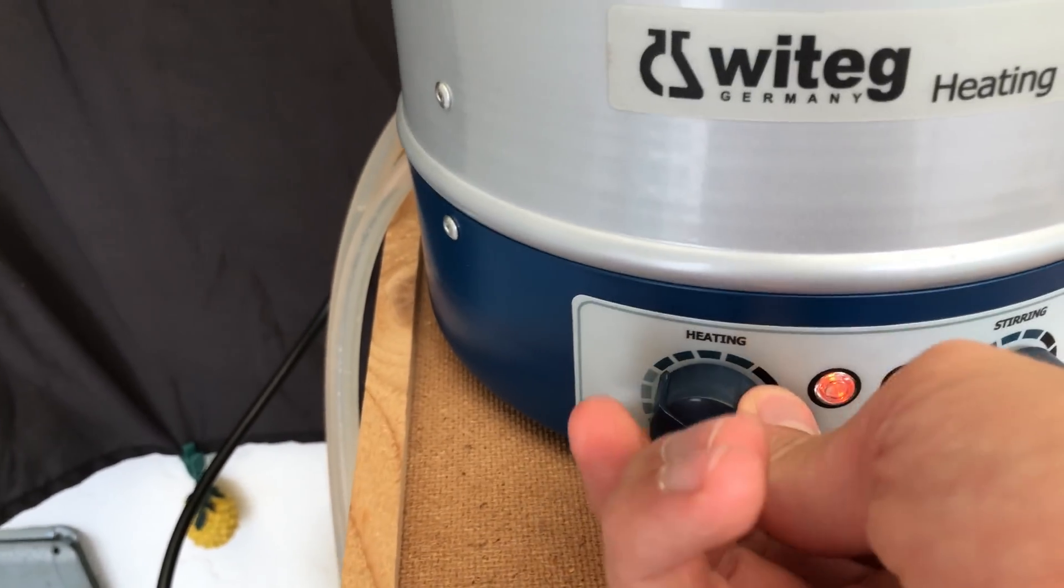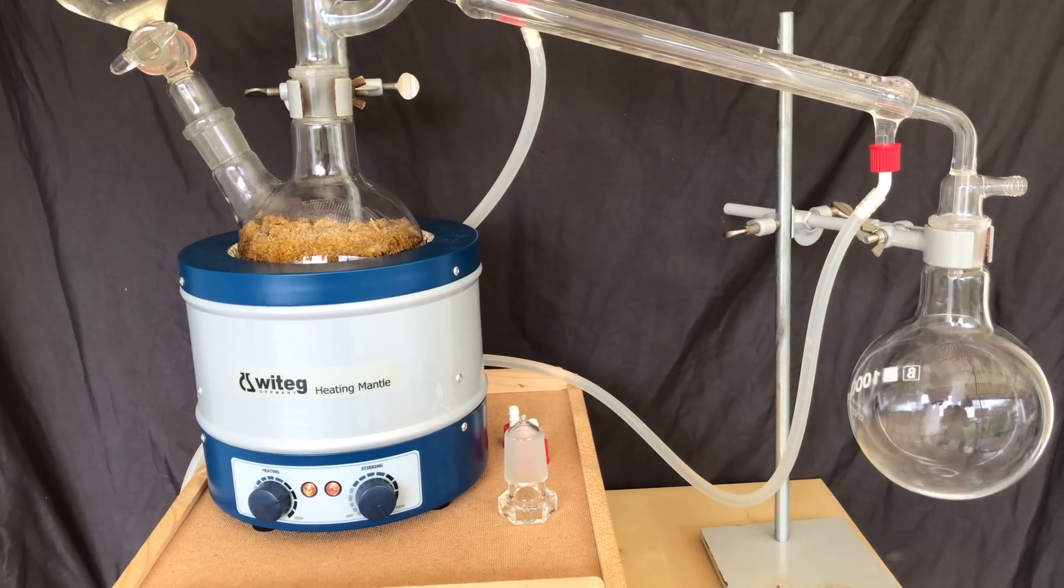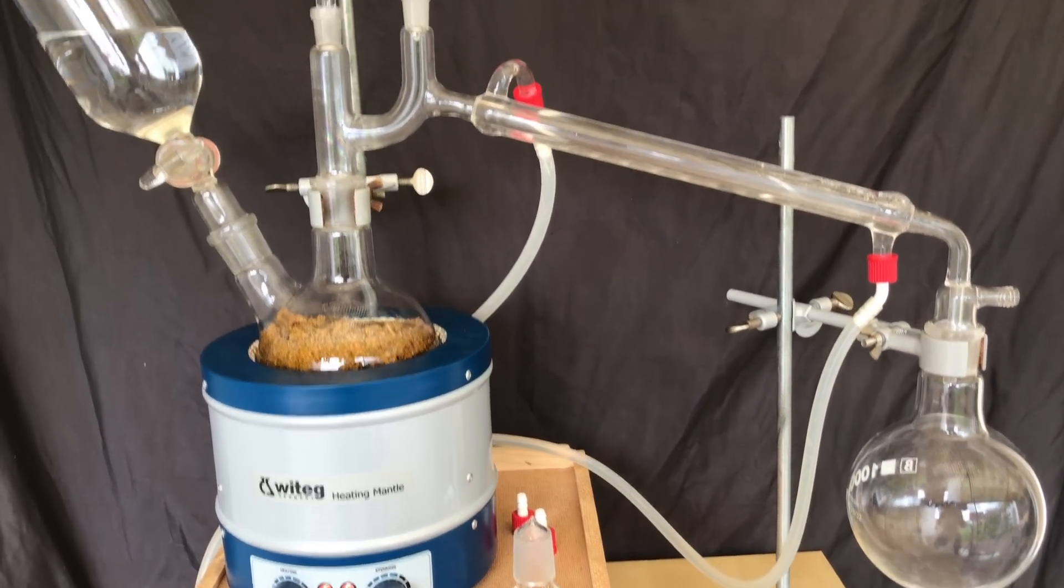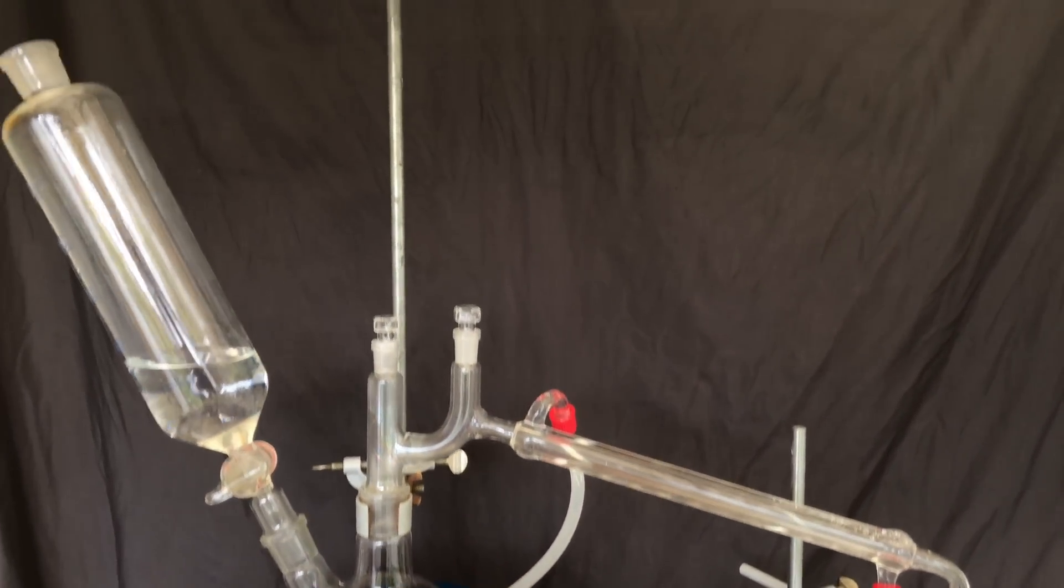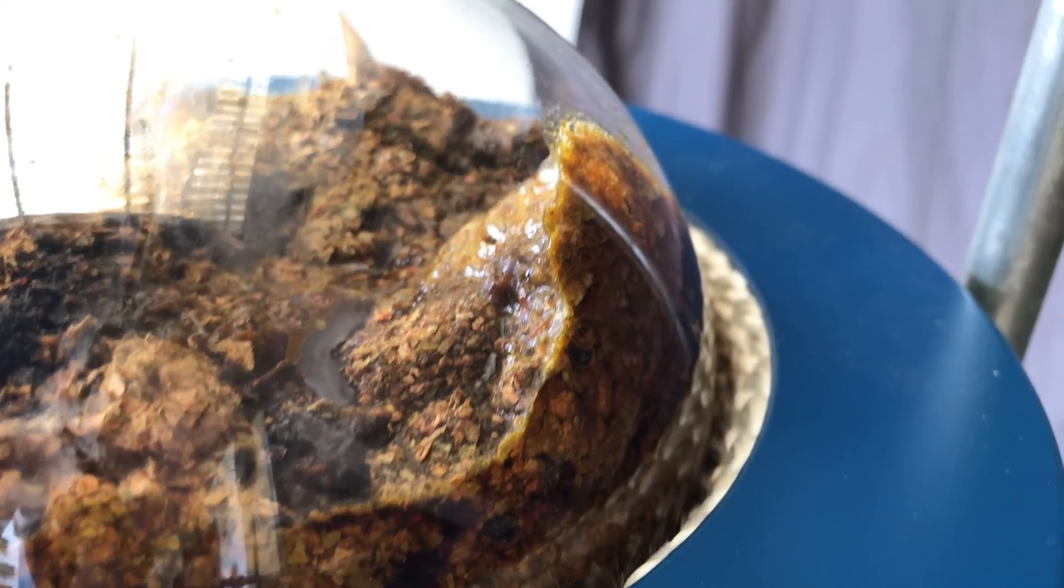Here you can have a look at the entire apparatus. On the left side, the addition funnel contains distilled water containing about 5 grams of additional potassium hydroxide.